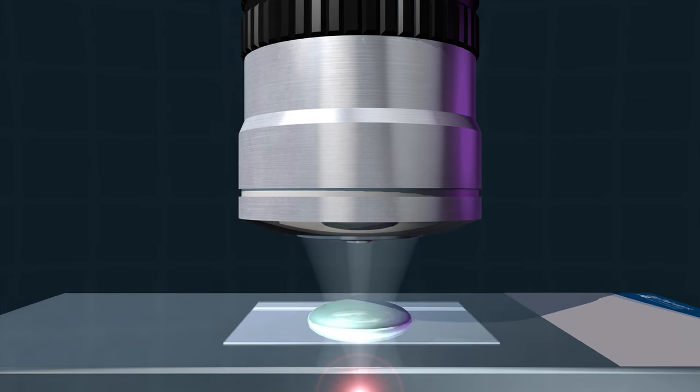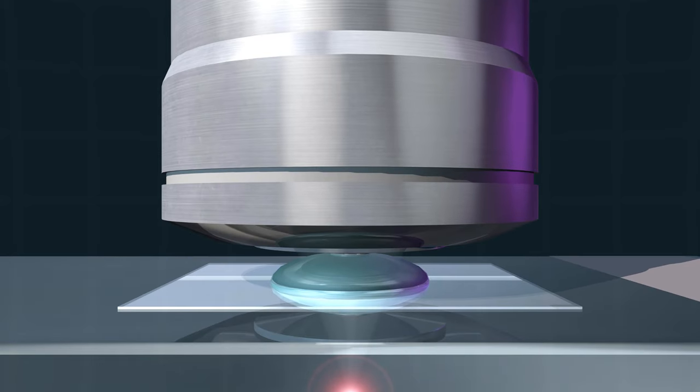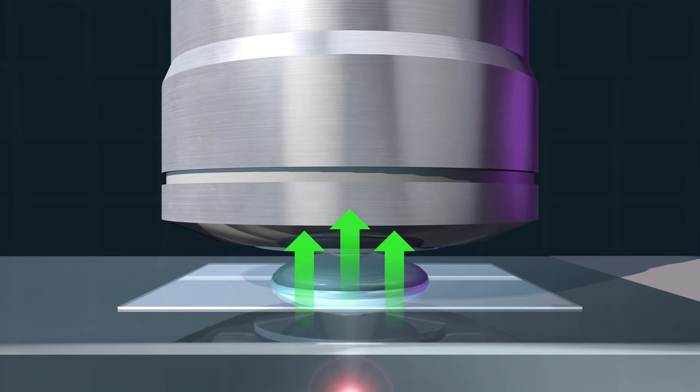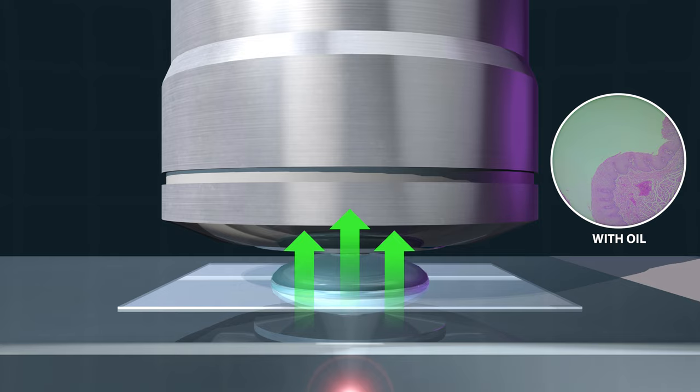Oil affects the light a lot like glass does. So we replace the air gap with oil, and suddenly we're able to see higher resolution images.